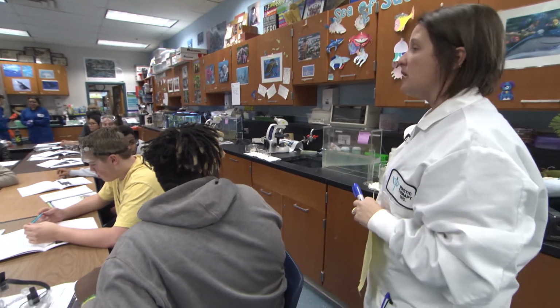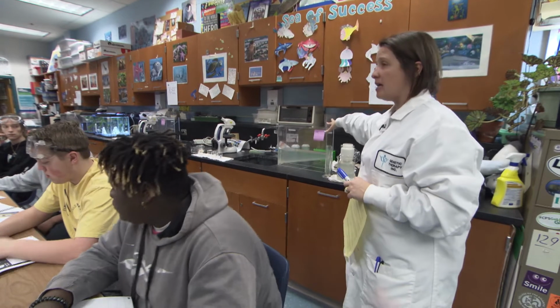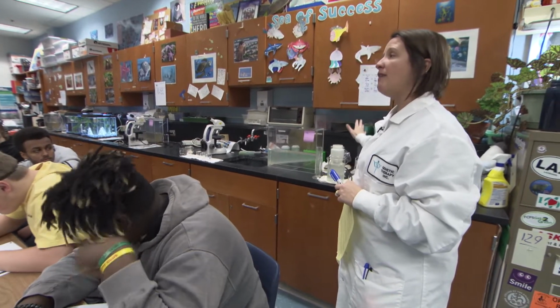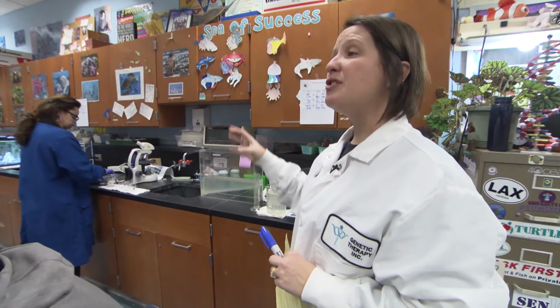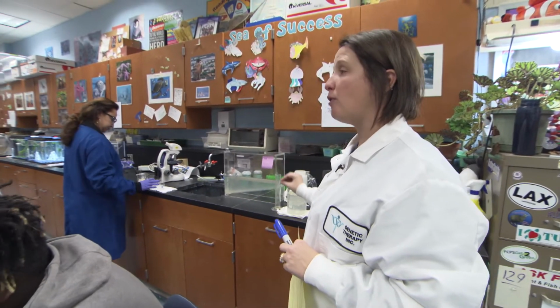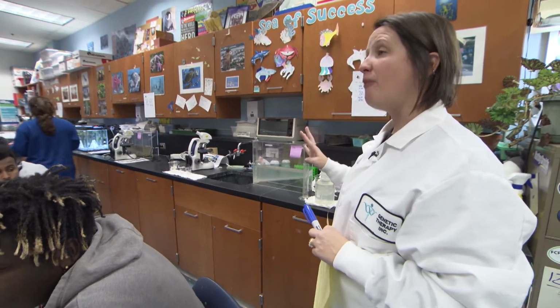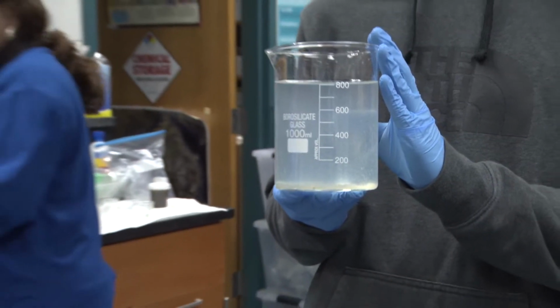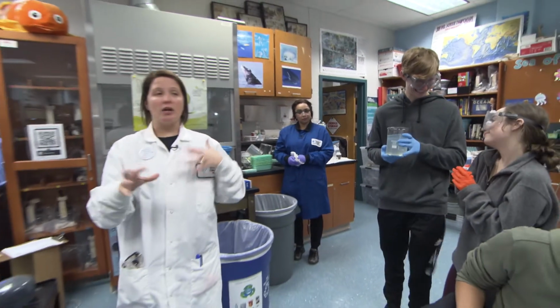We pulled a sample of about a liter of water off of the sedimentation tank. And then we've added bleach, because bleach has to have a contact time of about 15 minutes to kill any remaining microorganisms. So once we do test number 4, we won't need to be goggled because all the remaining microorganisms will be dead. We are now ready for the 4th step of the lab, appropriately called final treatment.